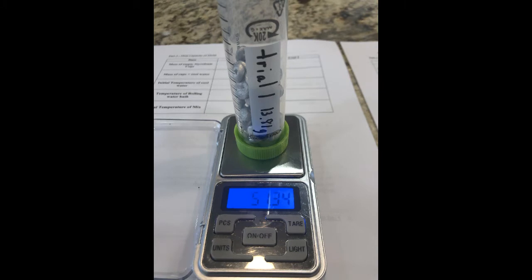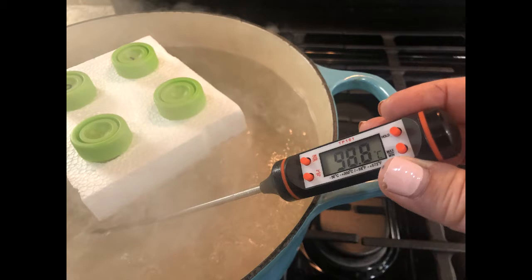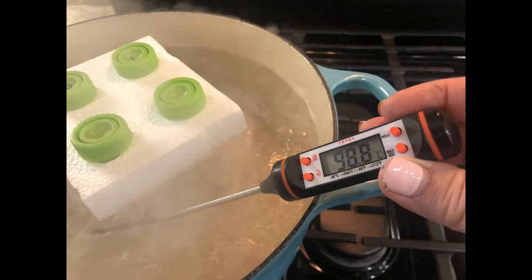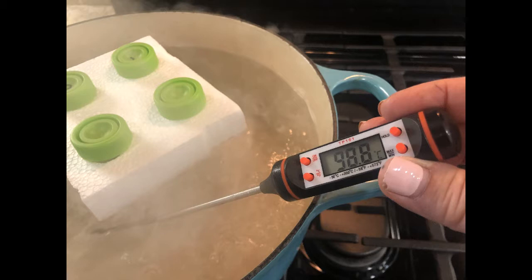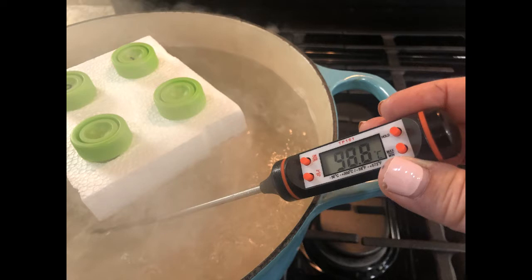For Part 2 and Part 3 you're going to need water and metal to have time to come to thermal equilibrium with the boiling water bath, which means it is super important for both parts that you leave those test tubes in there at least 10 minutes with the water boiling so the heat can get to the water or the metal inside the test tube.